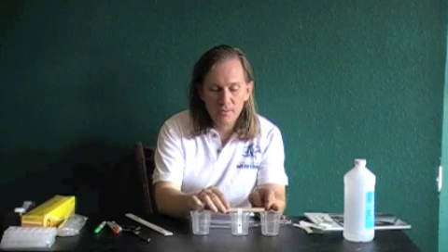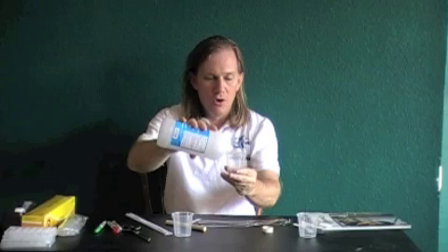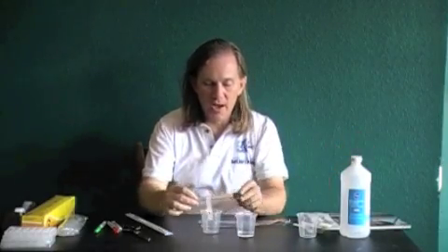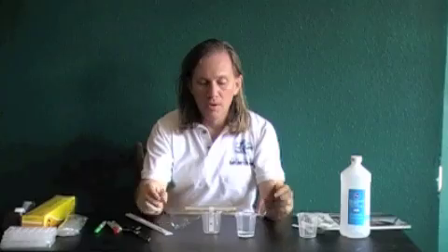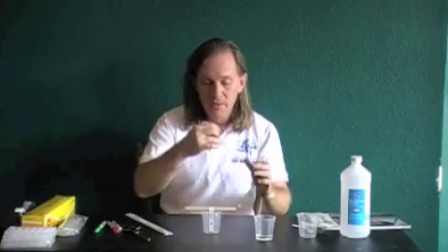You're going to put your alcohol into the beaker to about one centimeter, which is about 15 milliliters of alcohol, then drop the paper strip in. You're going to cover the whole thing with plastic wrap just to keep the alcohol from evaporating as easily. That's the whole setup — then you're going to watch what happens.